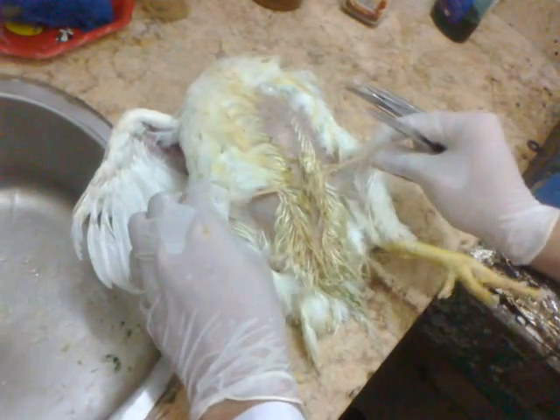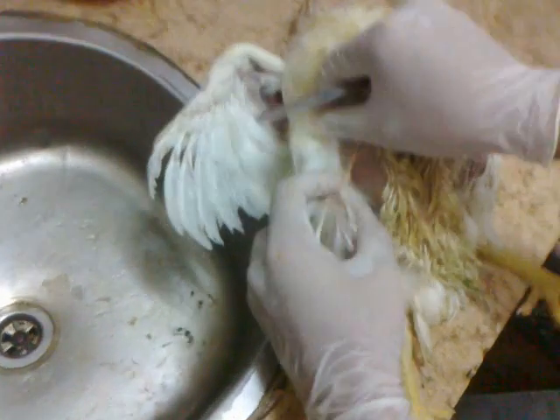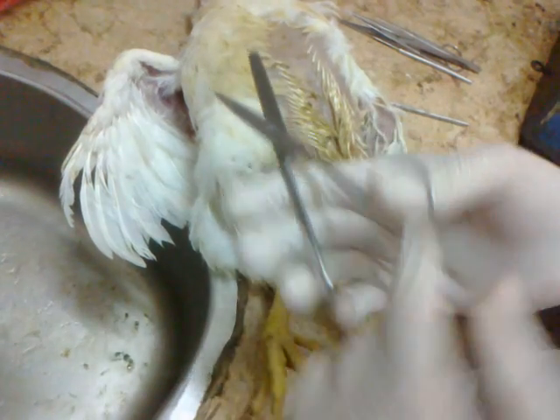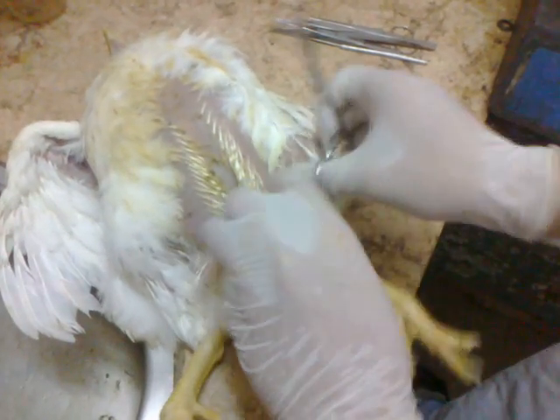This technique is called bilateral dissection, and we are continuing between them. You see here — this is a skin fold and this is a skin fold. The right way to catch with the scissors is like this, with this finger and this finger. Using sharp scissors will help you a lot if you have one.